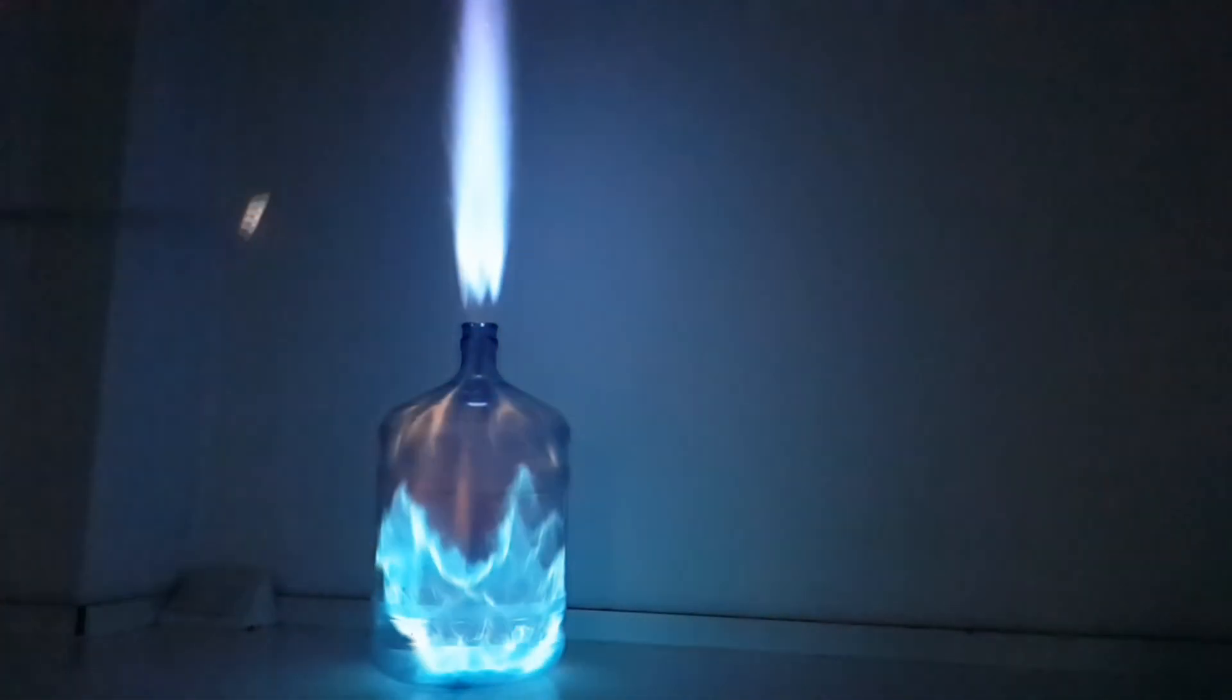Here we have a much larger container that's more transparent. This time we see something rather interesting. Let's see that again in slow motion.